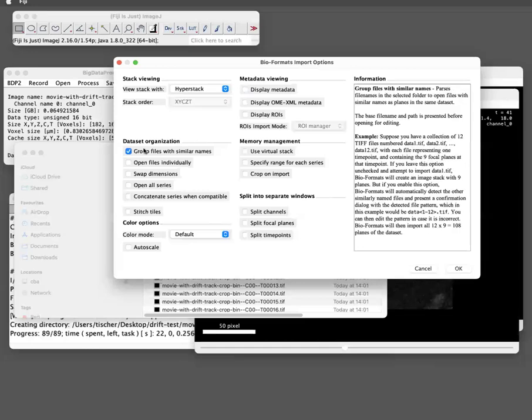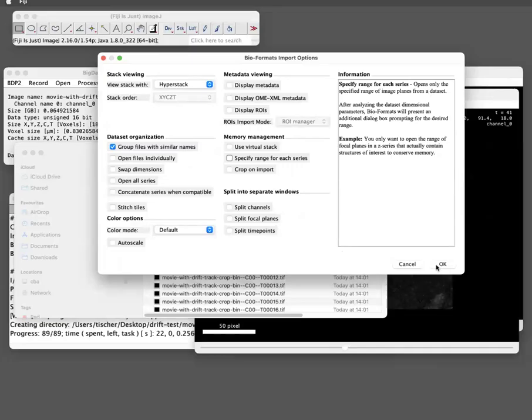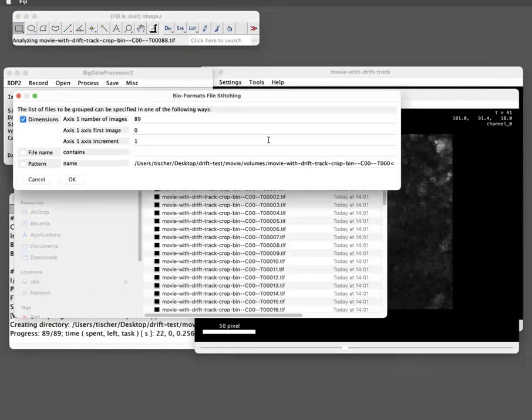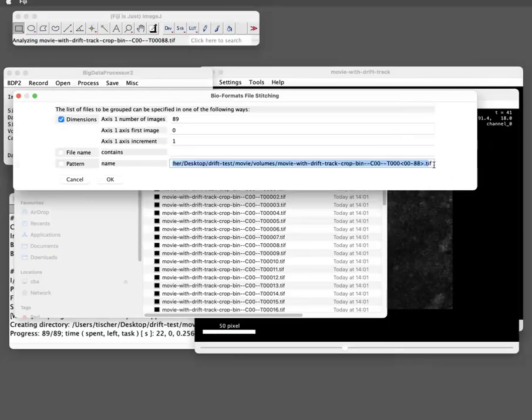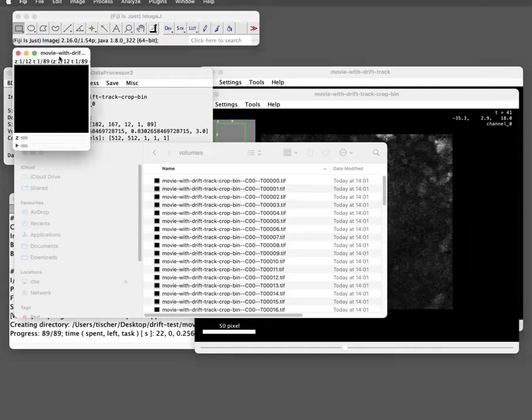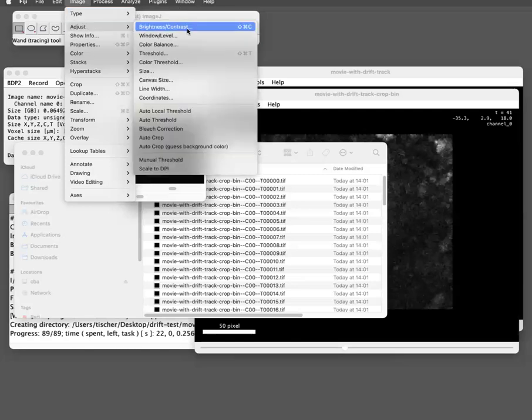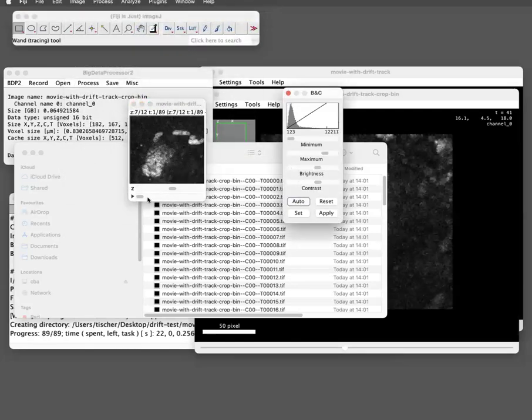And then there is this magic checkbox, group files with similar names, which is really, really useful. So you say, okay, and it actually automatically, because the file naming scheme is rather simple, detects that this should be the time axis. And then if you say, okay, it loads all the data, and you have now a normal FiJi stack with your drift corrected, cropped, binned movie.